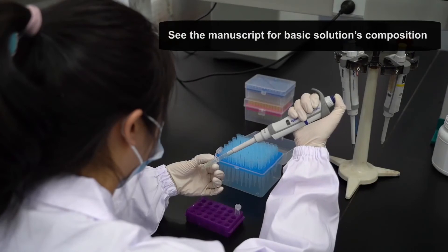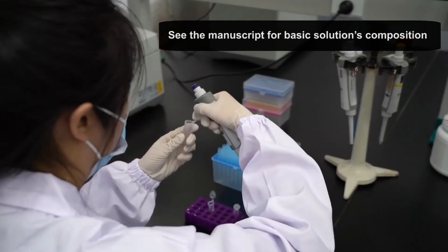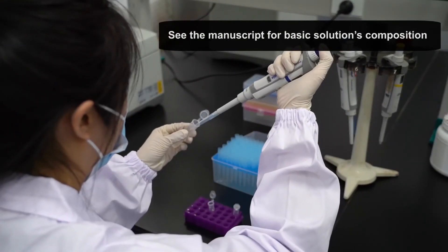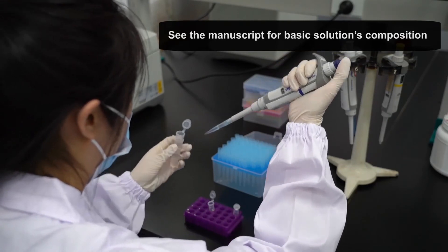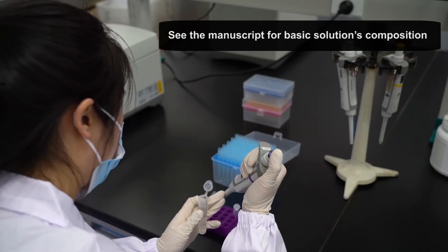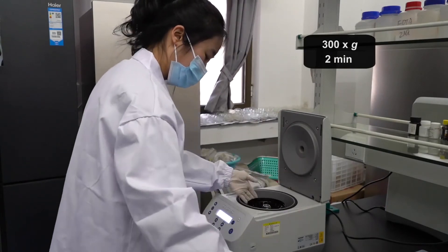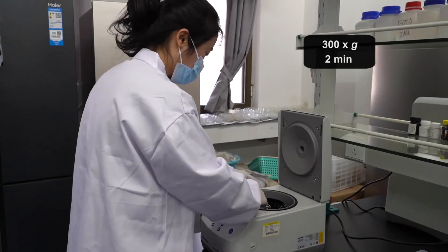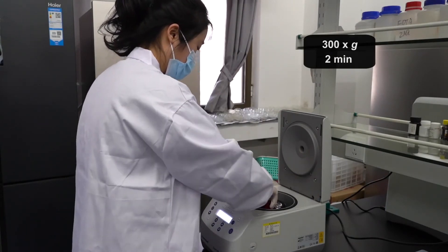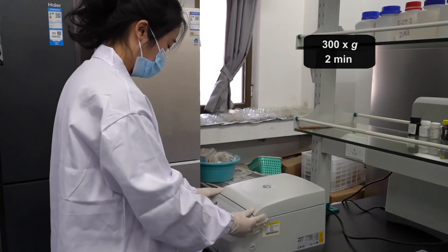After that, wash the pulp pieces, aspirate all the enzymatic solution, and then add 0.5 mL buffer solution. Centrifuge at a speed of 300g for 2 minutes. Protoplast suspension can be obtained by aspirating the bottom solution.